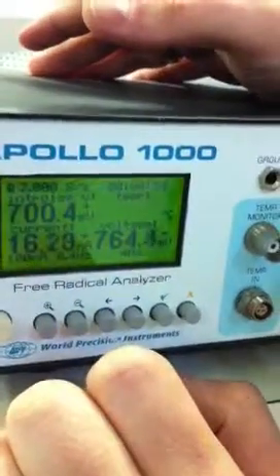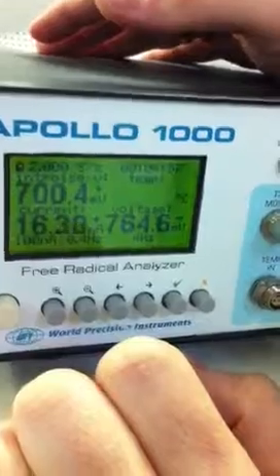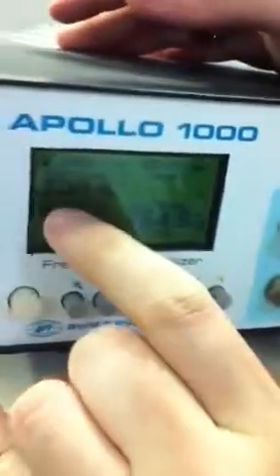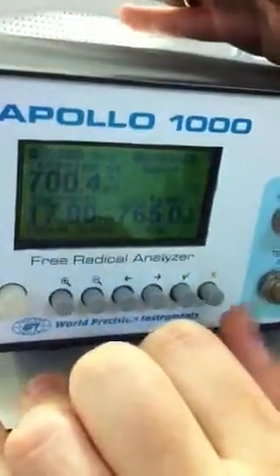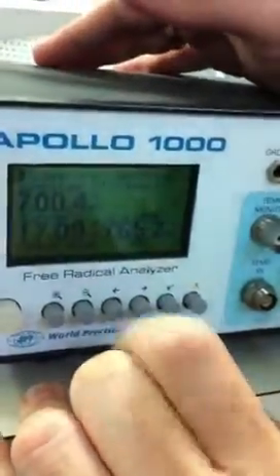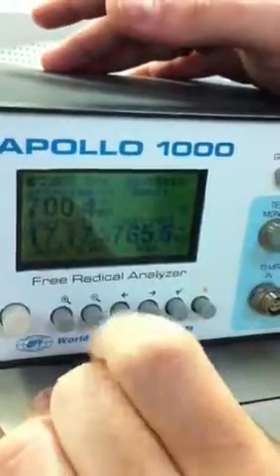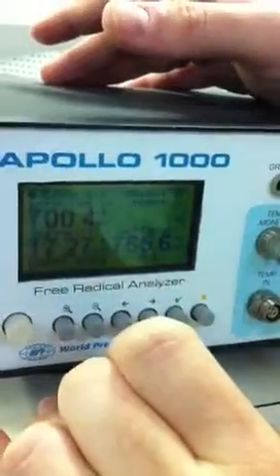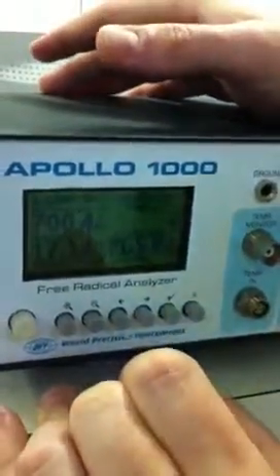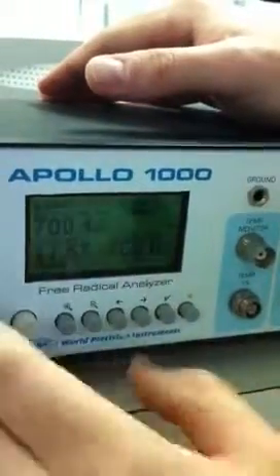And then the millivolt range for NO is 800 and... Well, you want to set as close as you can to what it should be. So for nitric oxide, it should be 850. And for hydrogen sulfide? Hydrogen sulfide it would be 150 millivolts. And so oxygen is 700. Hydrogen peroxide is 450. Okay, cool. So again, that will be described in detail in the manual.